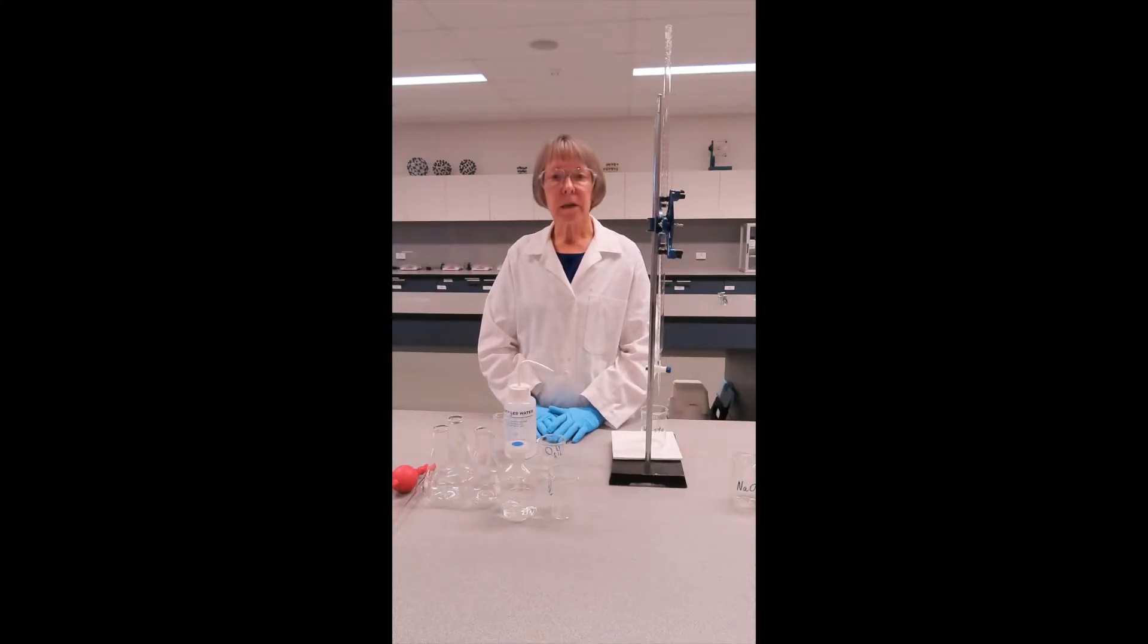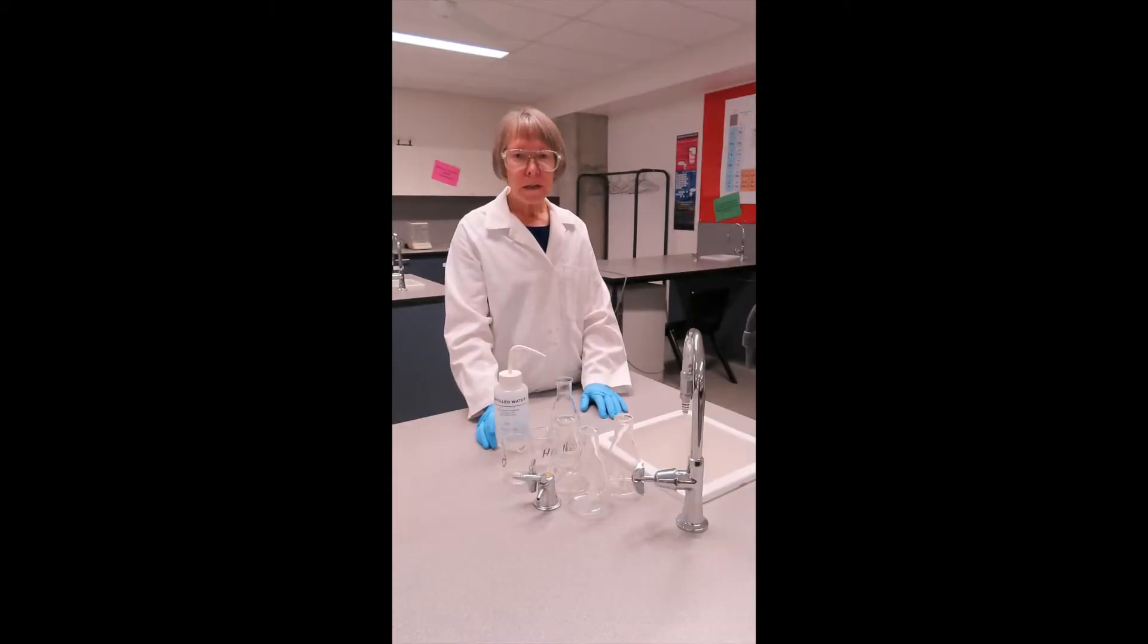I'm going to demonstrate the technique of doing a simple acid-base titration. Because the titration has to be quantitative, we want to be very accurate and precise in the results we get. We need to make sure that our glassware is prepared appropriately.